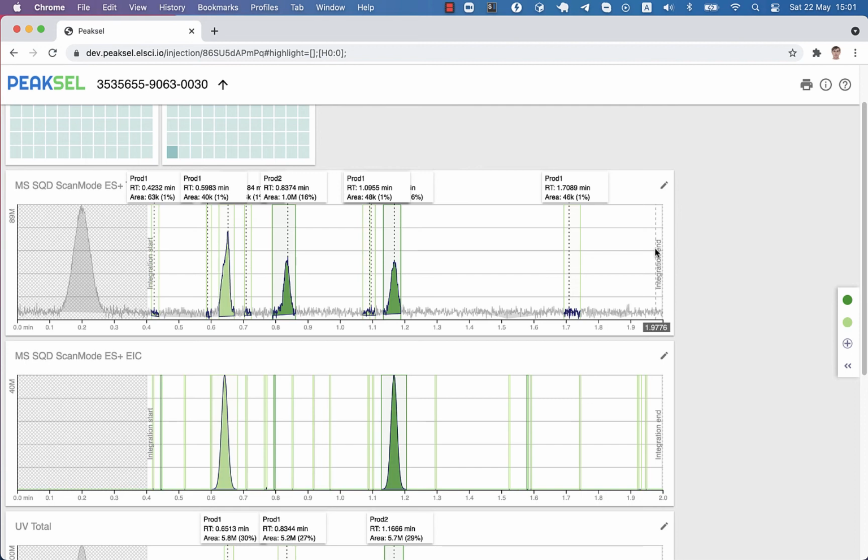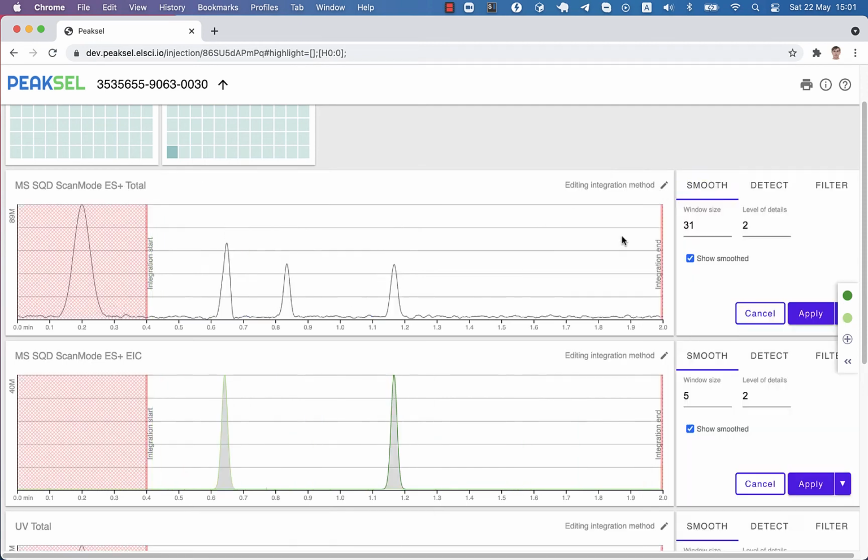When you start analyzing your first chromatograms in Peaksel, you'll quickly run into the necessity to modify processing methods because the default will probably not work for you. You may end up with too many peaks or too few, or the boundaries and the baseline will not satisfy you. What you want to do first is to find the right parameters for the integration.